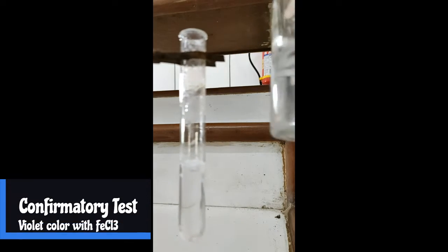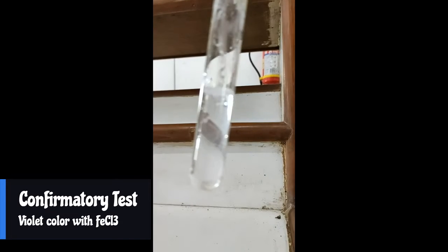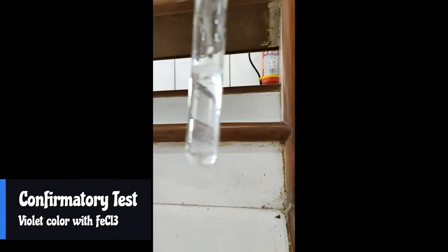Now to finally confirm that it is salicylic acid - you have confirmed that it is aromatic, then COOH group, then acidic. Salicylic acid you can confirm easily by addition of neutral FeCl3 solution.